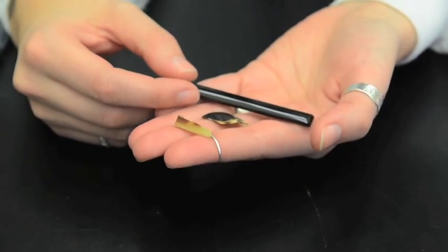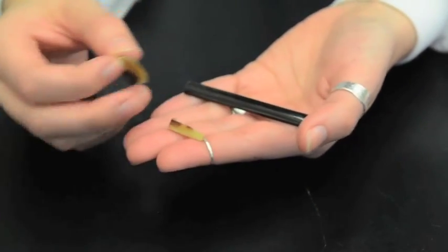By the end of the time we spent in the lab, I actually had come up with a tool that could be used to distinguish between horn and tortoiseshell, something I never thought I would be able to do coming from an art historical background. And it's just really incredible that even experts in the field, such as the ones I spoke with at the Peabody, think that this tool is going to be valuable for them.